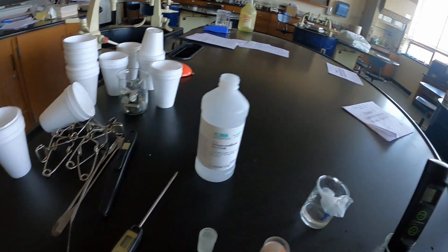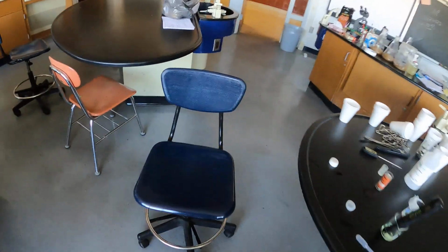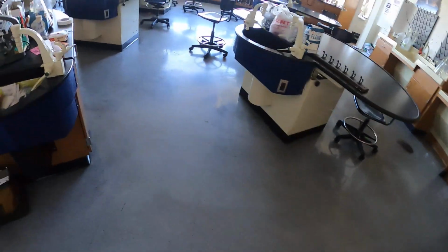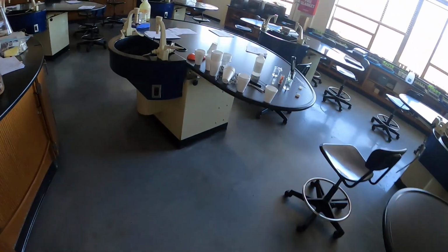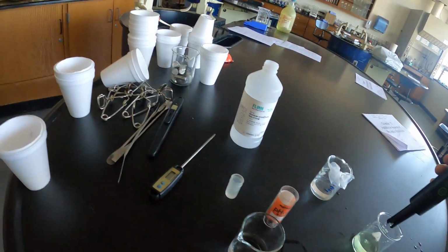So I'm going to start by putting this pH meter, which is calibrated, into some pure water, and then I'm going to add a little bit of strong base to it. Now, water is a terrible buffer. It really can't handle pH changes, right? The second you add acid or base to water, the pH changes drastically.